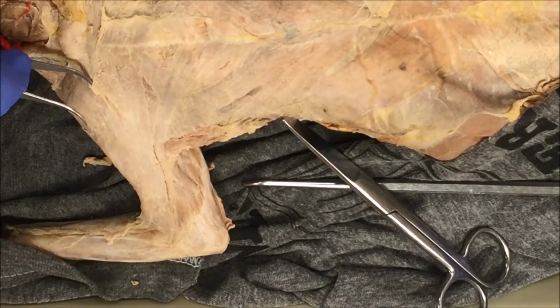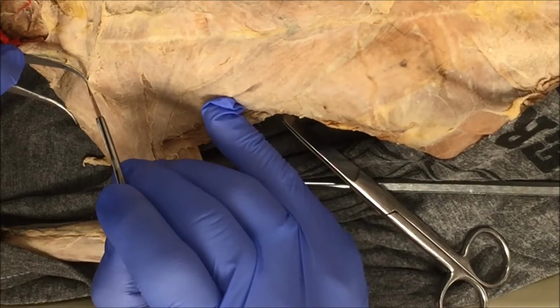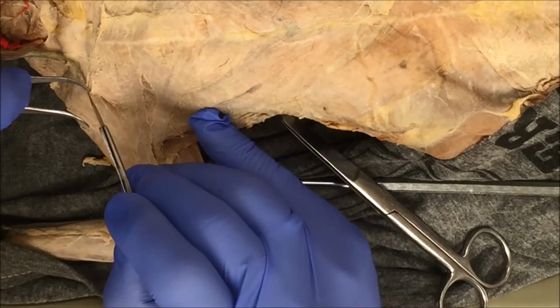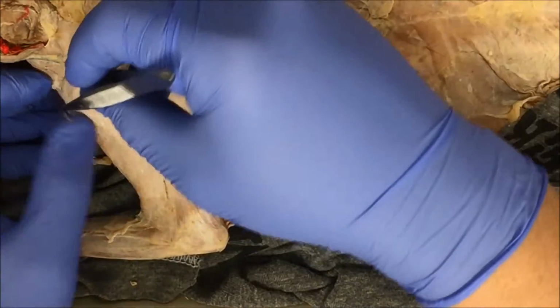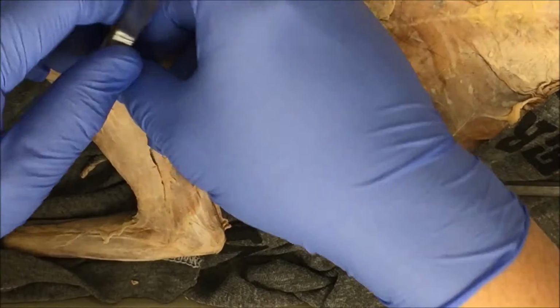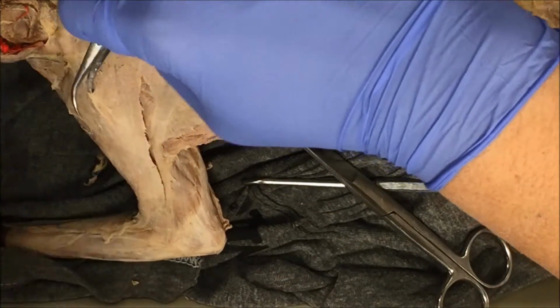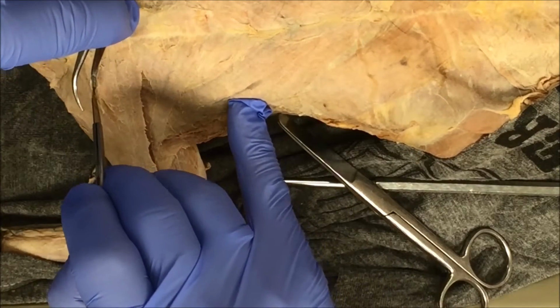By now, you guys have mastered your dissection techniques, and you can easily start to separate muscles. So here's another technique. I'm going to get my forceps under, and this time I'm going to use my scalpel, and I'm just going to cut along the forceps, protecting the underlying muscles. So I lift with my forceps. My forceps are now protecting underlying structures, and I'm just going to run my blade on top of the forceps.